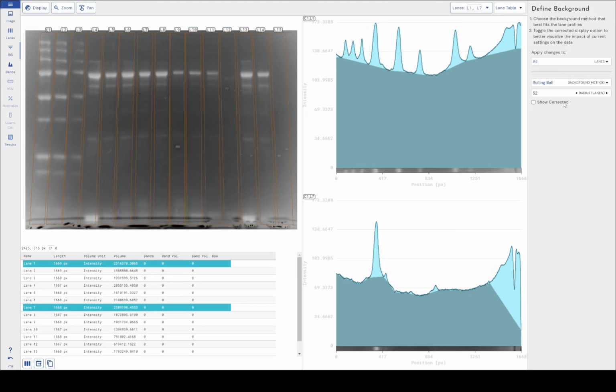If you're coming from our older software, such as TL100, you may be used to this technique being displayed in pixels. So this radius, it describes the radius of the ball that we're rolling underneath our peak. Bigger numbers, bigger ball, smaller numbers, smaller ball. We used to use pixel value when lanes were much smaller. So when I say smaller, I mean smaller in terms of pixels.